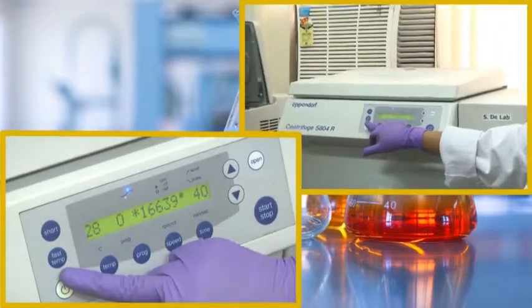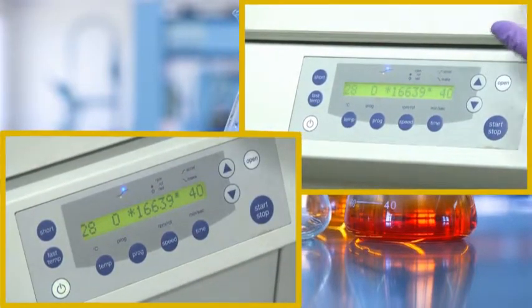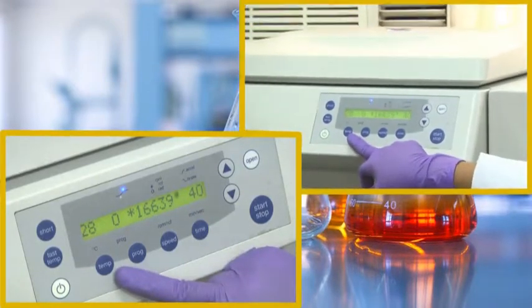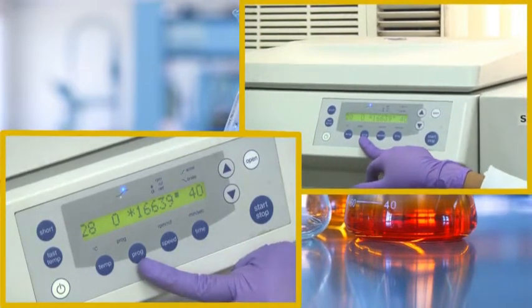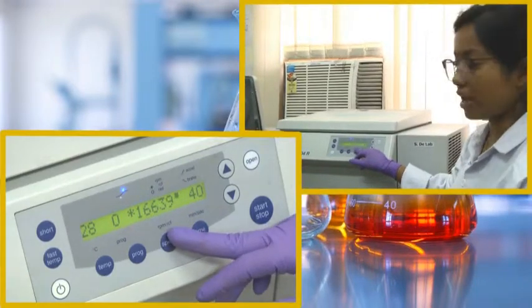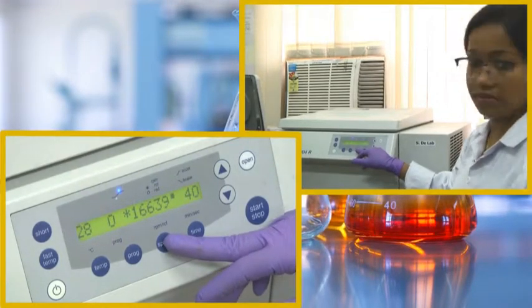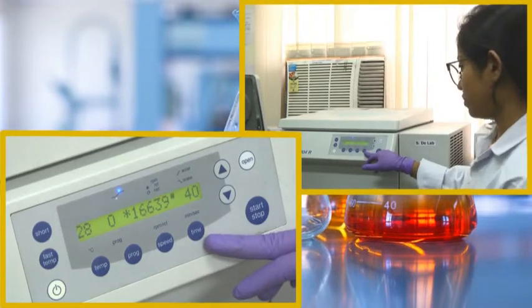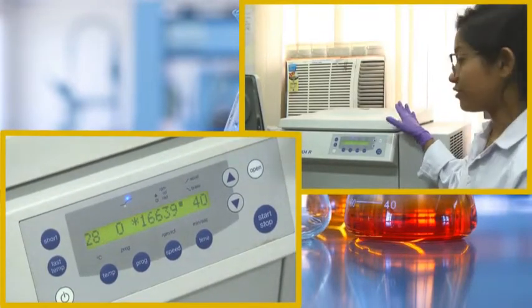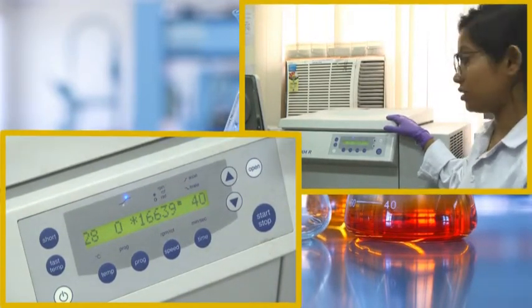If your sample is very heat-sensitive, first pre-cool the centrifuge to 4 degrees centigrade before putting your sample in. Our protein can withstand normal temperatures so we are not doing that. There is a fast temperature mode where the rotor reaches 4 degrees before you load the sample. There is also a short spin mode and multiple programmable settings. The G value is important because it represents the actual force generated. The centrifugation is now running — after 40 minutes we will divide the solution into supernatant and pellet fractions.